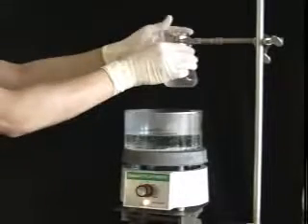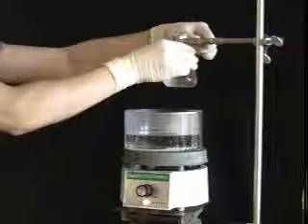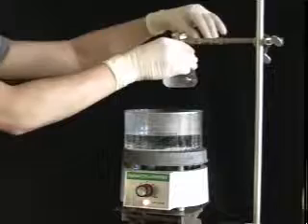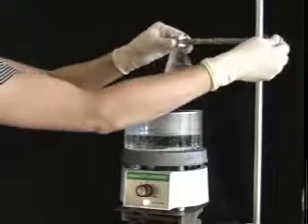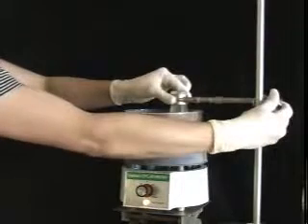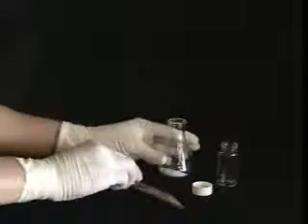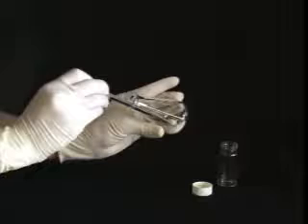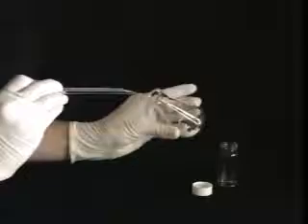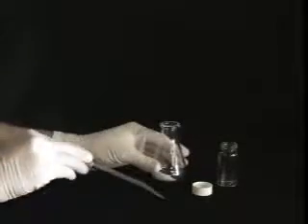Now that we have decided on a solvent, it is time to dissolve the sample in some hot ethanol. Get ready by heating some ethanol in the water bath. Remember to add some boiling stones and clamp the flask securely so that it doesn't tip over. Place the sample in an Erlenmeyer flask, but before adding solvent, it is a good idea to set aside a small crystal. It may come in handy later if you have trouble getting crystals to form.